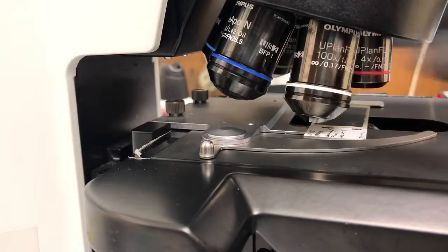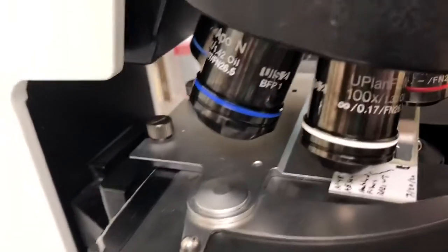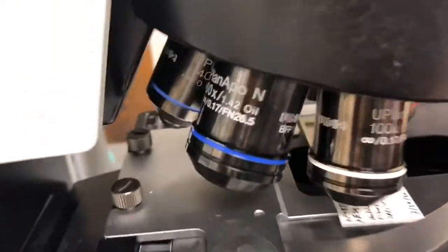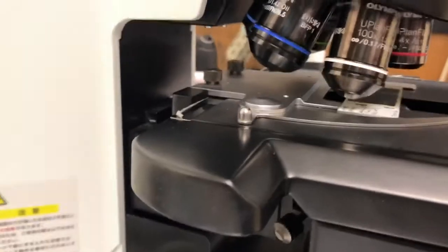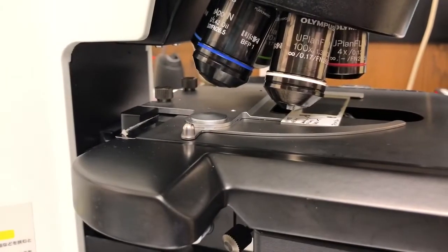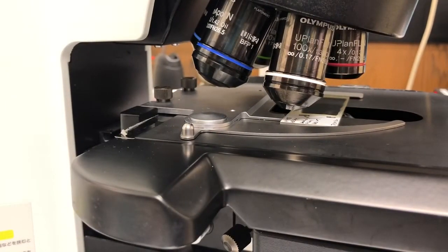Those are in these positions and you can see that right now they are both on the microscope. There's the 100x, there's the 60x, but that won't always be the case because those objectives are swapped for other low magnification objectives that people sometimes need to use.